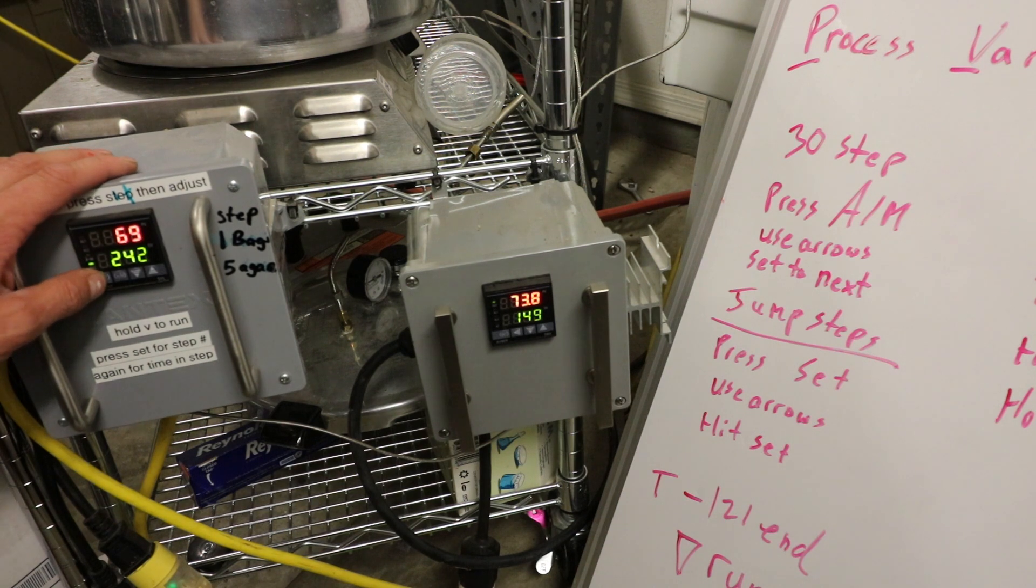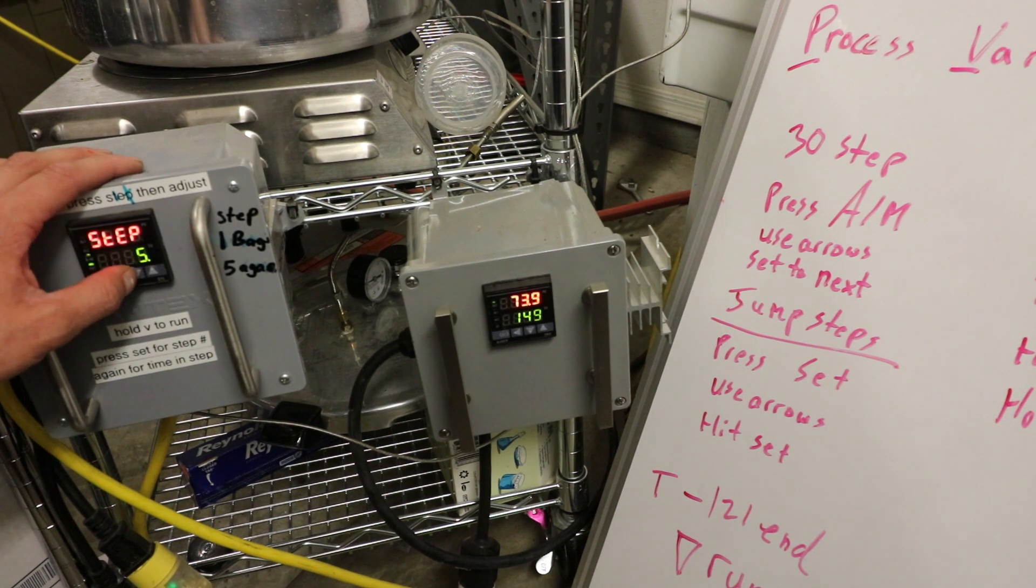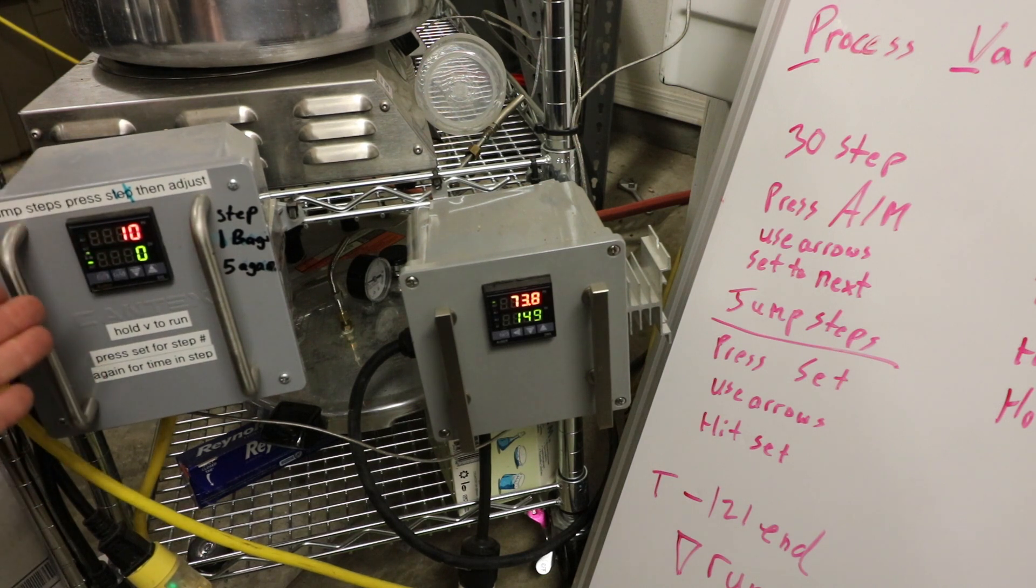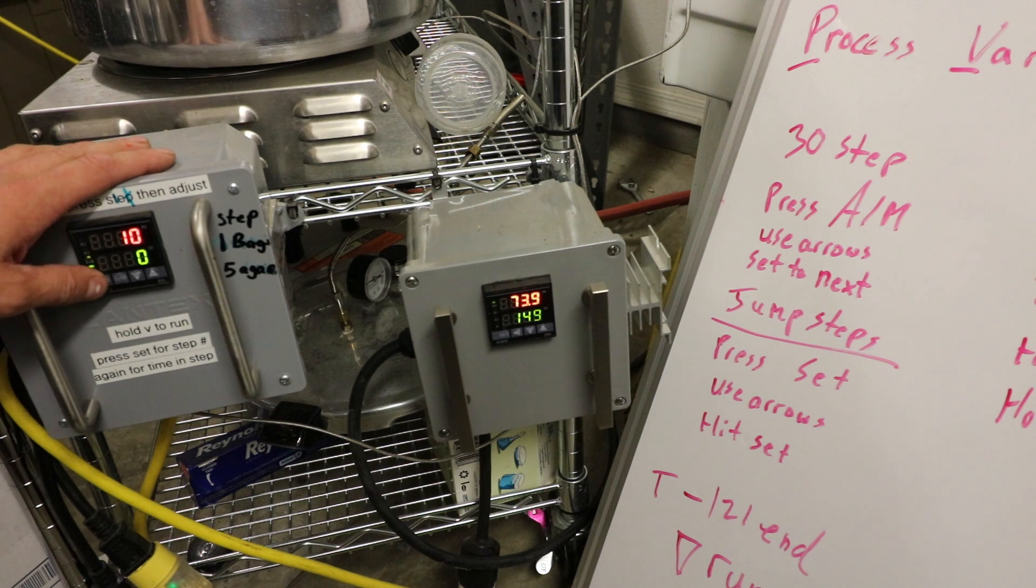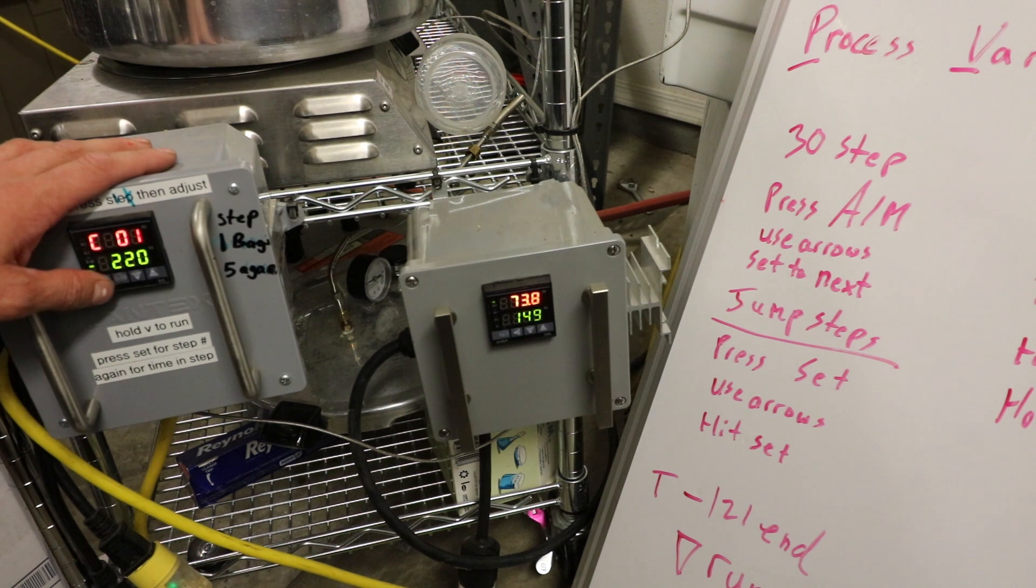So we're going to hit set, and then I'm going to go to step one because I want to do bags, and then I'm going to hit set. And now it's in step one, which should be the warm-up. It's going to be 10 minutes of like 243, something like that.